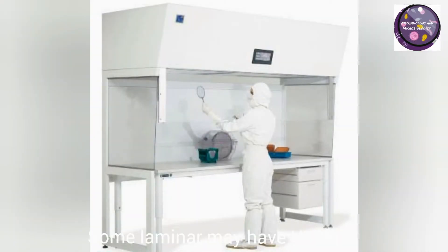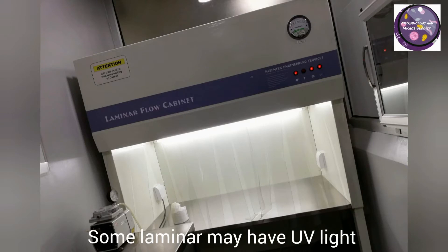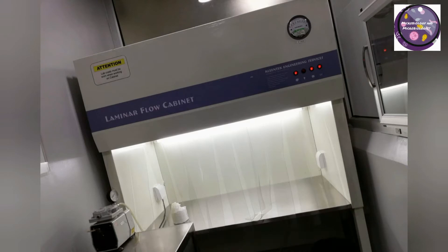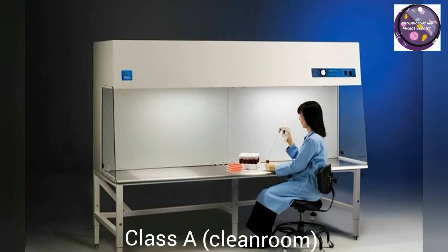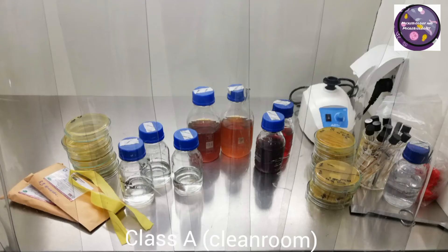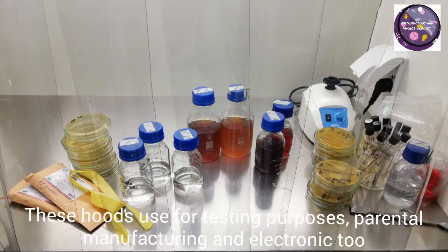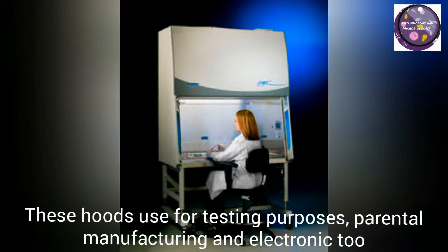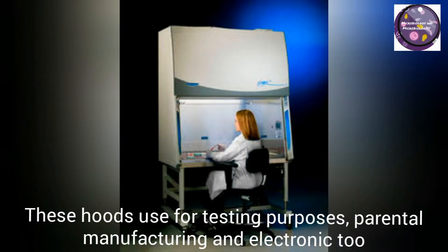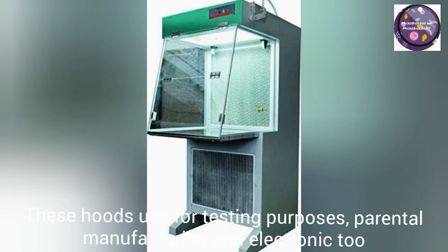For some critical testing and manufacturing of some critical drugs, some hoods may have UV light to provide extra protection and prevent contamination. Laminar airflow hoods are considered Class A. They are used for testing purposes and some kinds of manufacturing, like parenteral drugs and some kinds of electronics.